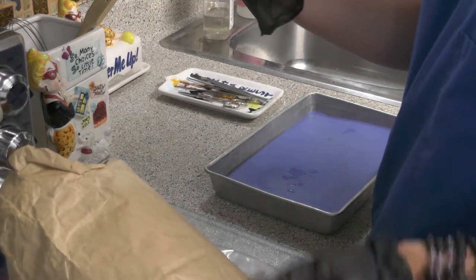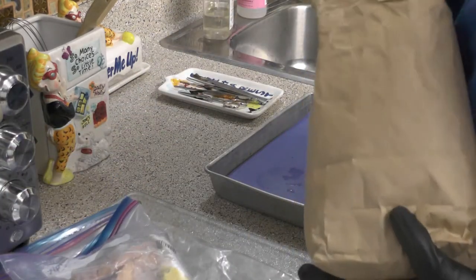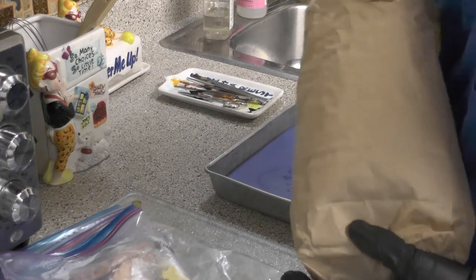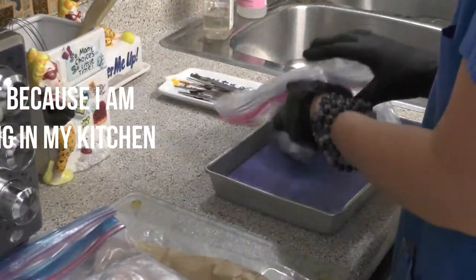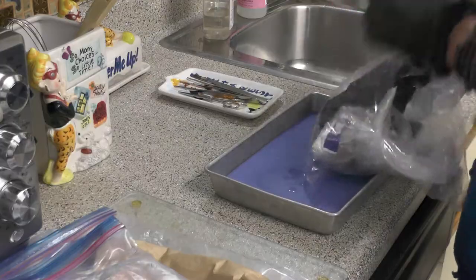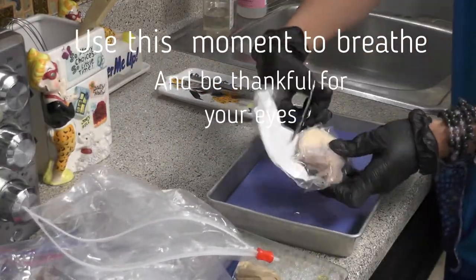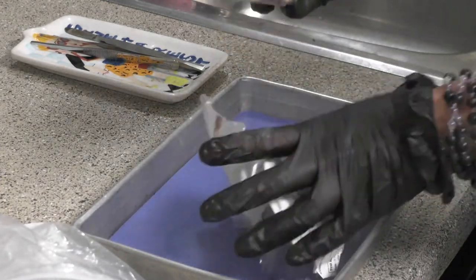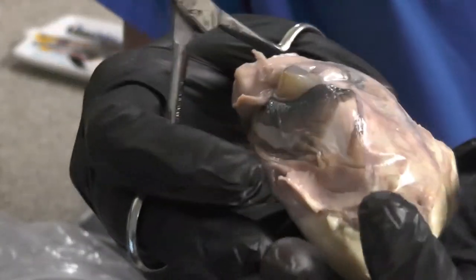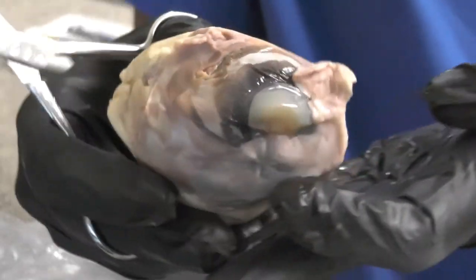It's hard to manage a computer and the dissection at the same time, so I'm looking at everything you need to know right now, but if I don't hit it all while I'm doing the dissection you can look at it on Mastering. If you recall, we said that adipose tissue can be found protecting some organs like the eye and the kidney — there's a whole bunch of adipose tissue that I'm going to have to remove before we can really get into this eyeball dissection.